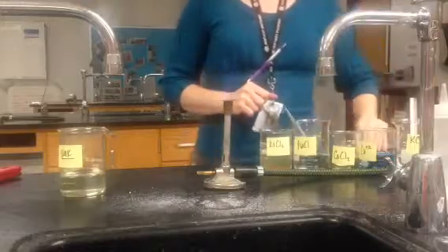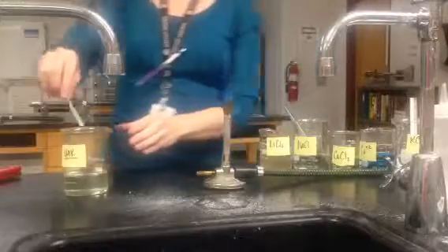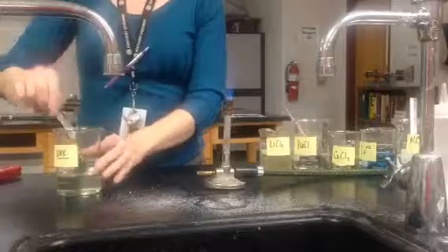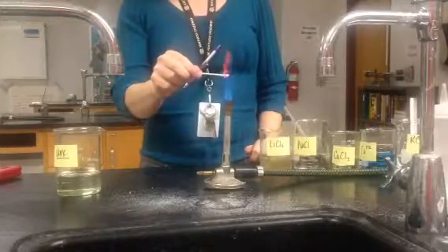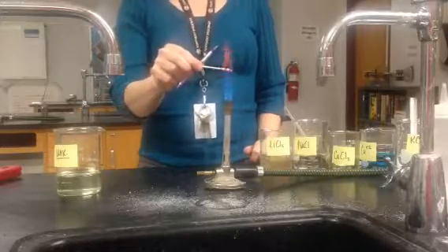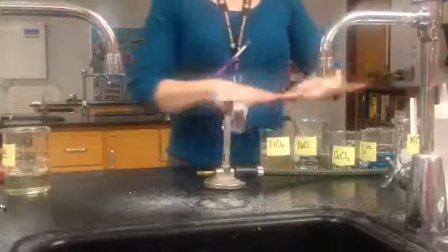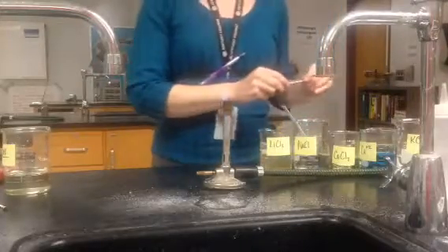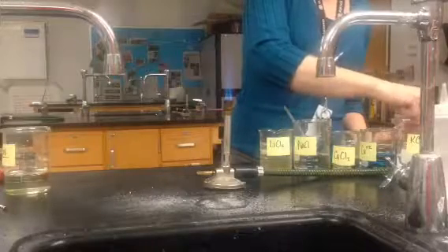You're looking for the unique spectrum. We will start backwards — I'll let you see the unknown spectrum first. Just look into the flame here. Okay, the unknown is very much a reddish orange color. Keep that in mind because you're going to try to deduce from using all these other chemicals which one might be the one that killed your classmate.